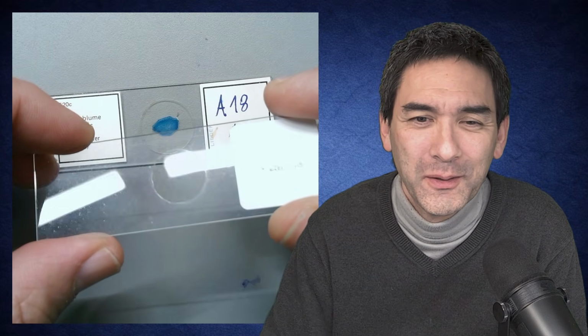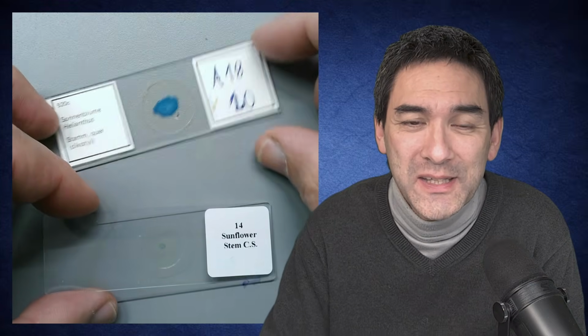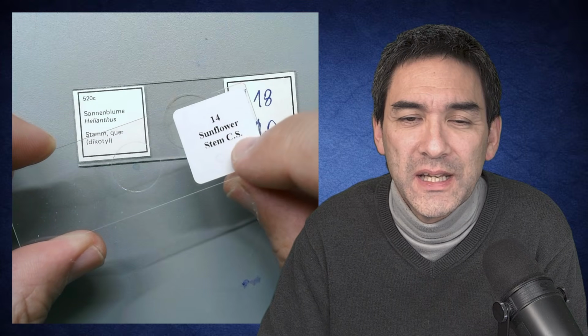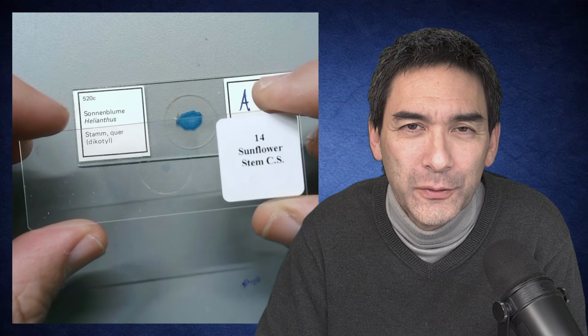So I've got two microscope slides here. This one here is a fairly cheap one that I bought in a pack together with approximately 100 other slides. And this one over here is fairly expensive. Both of them show the cross section of the stem of a sunflower. It says here CS, which stands for cross section. However, the quality is quite a bit different.